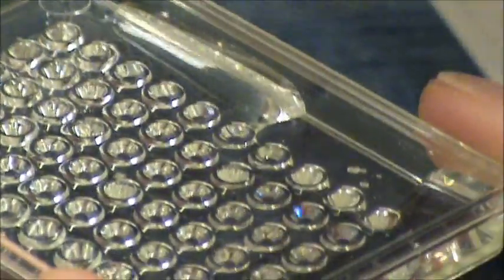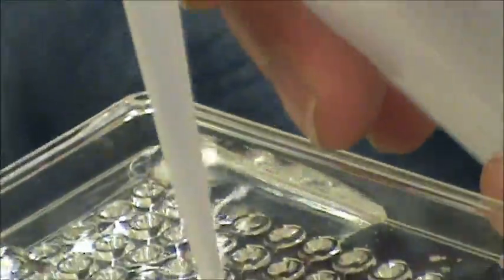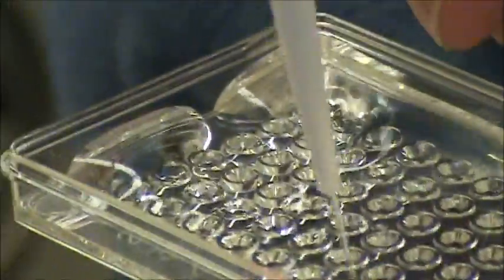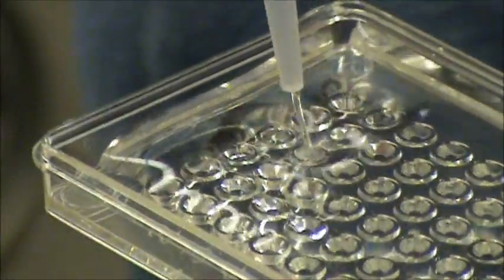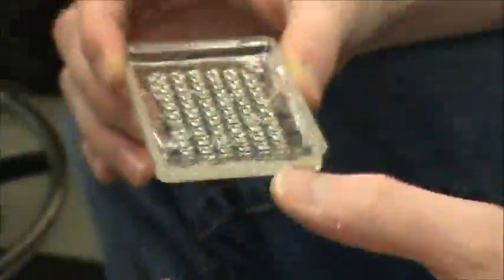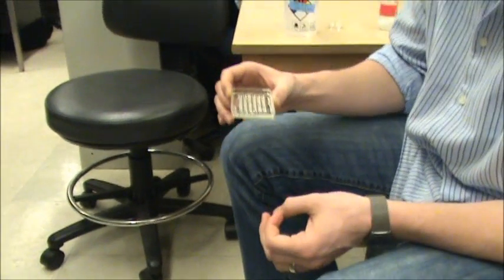If you look on the well you see on the sides we've got A through F and one through ten. These are really nice to help us remember where we put our cells. We don't want to forget which cells we put in which dish. All right, now they're all full. Just shake it around and we'll be able to add our cells in here.